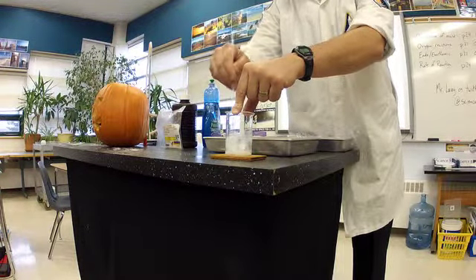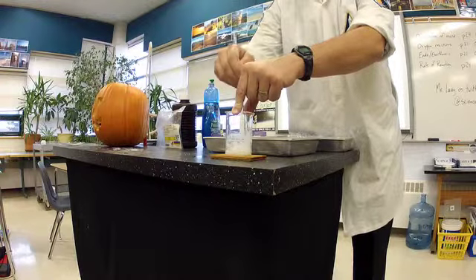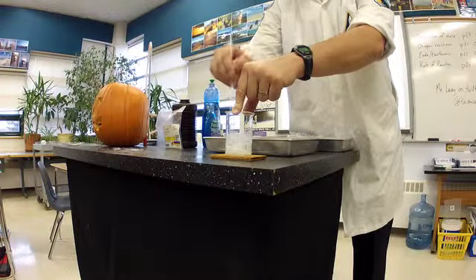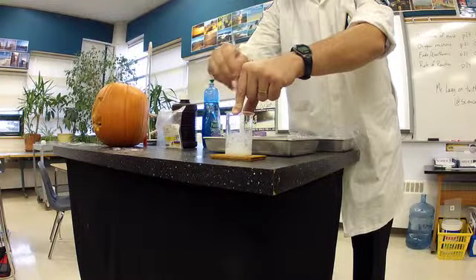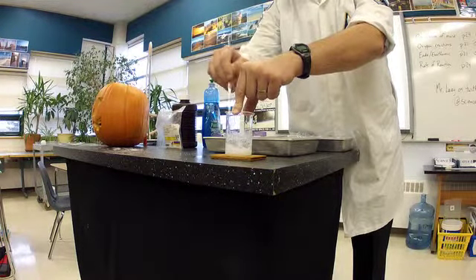What does it look like now? Kind of like a slurry is one thing I heard. Slurry is a grade A term. It's when solids have liquid-like properties. So it is slushy, another way of describing it.